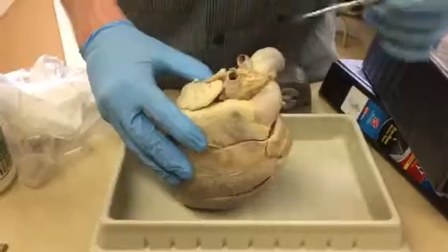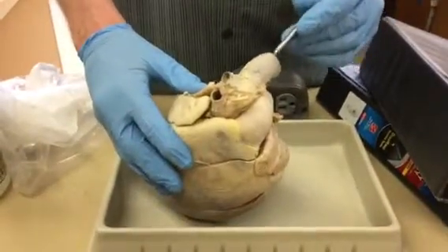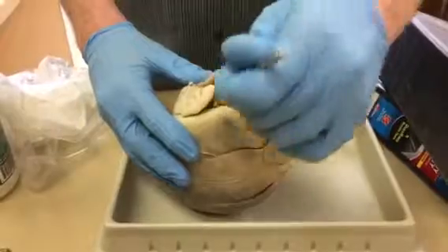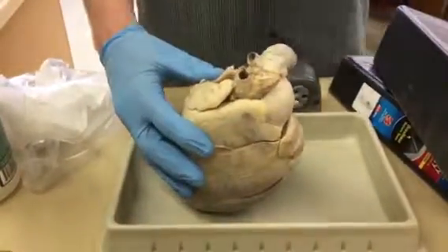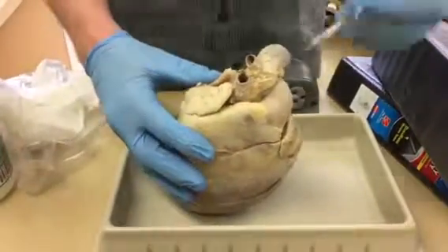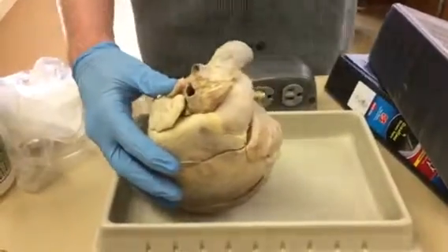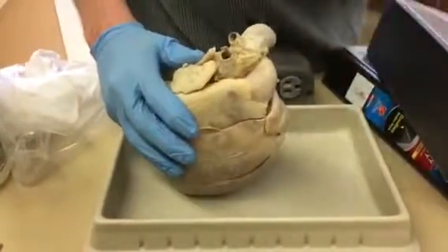Okay. There are coronary arteries that also are here. They are deep inside the aorta. They're the very first branches way down here, and so I can't pin those either. They're inside because they're bringing oxygenated blood to the heart first. So they're the first place that oxygenated blood goes. I wouldn't be able to pin them very well because I'd have to stick something down here and ask some question that made you know where I was really pinning because you can't see it, but they are there. Okay. So it's good to know that they exist.